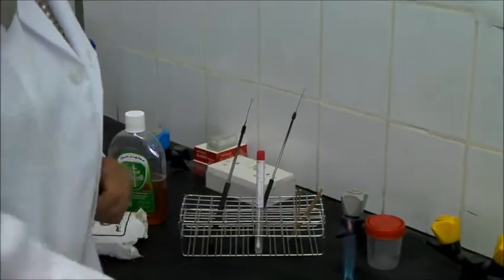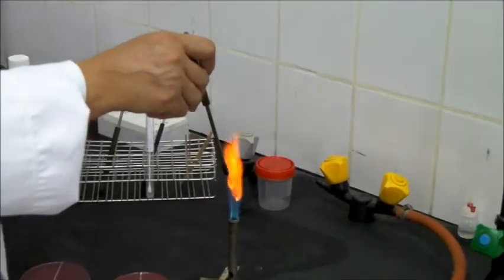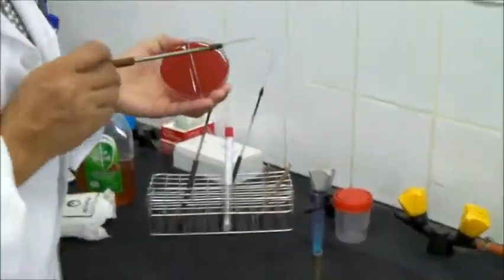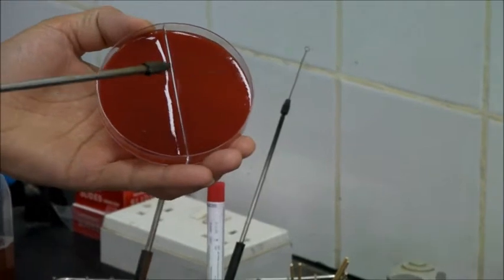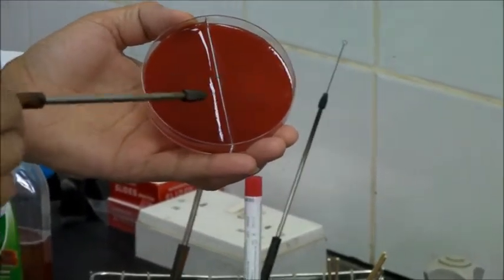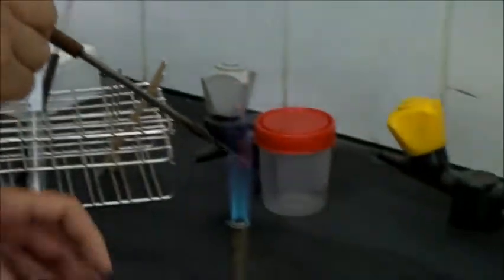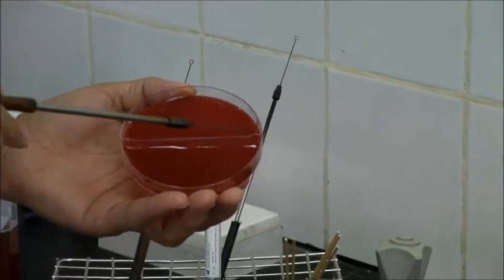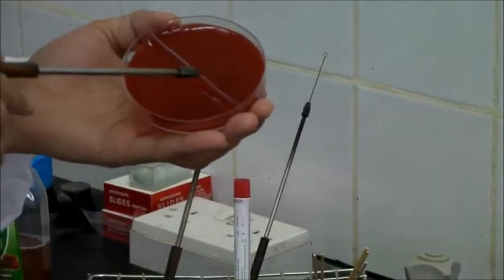Now we place the swab inside the tube and discard it, then we start flaming our loop to sterilize it. When it becomes red, we take a sample from the first streak which we applied on the blood agar and start making a few streaks. Then we flame the loop again, rotate the plate, take a sample from the second streak, spread a few other streaks, and the last streak is without flame.